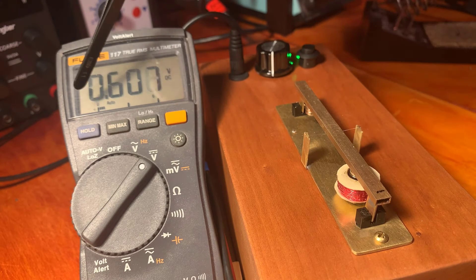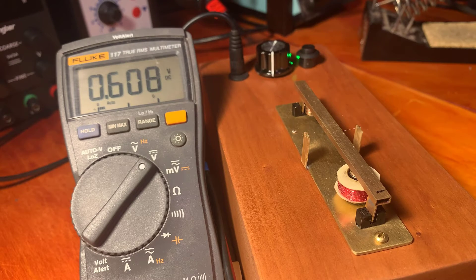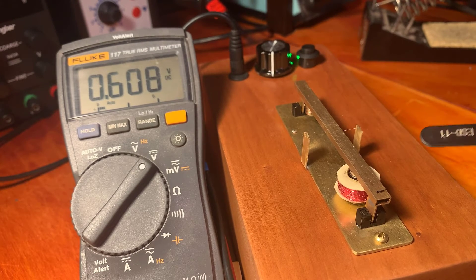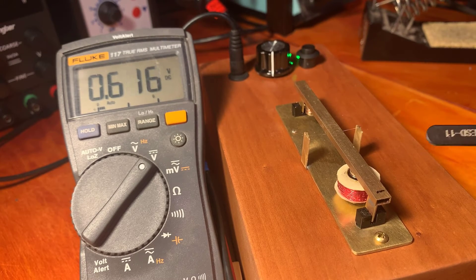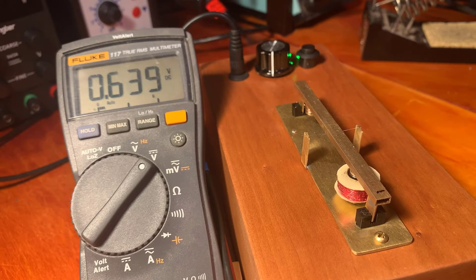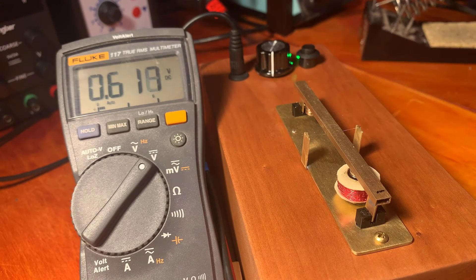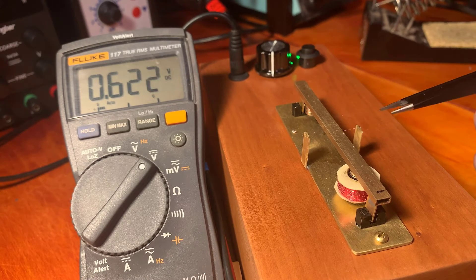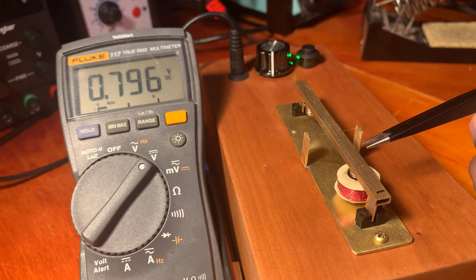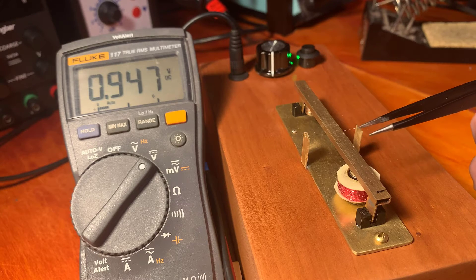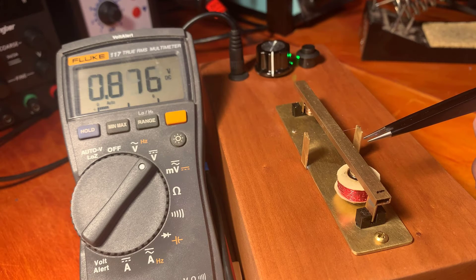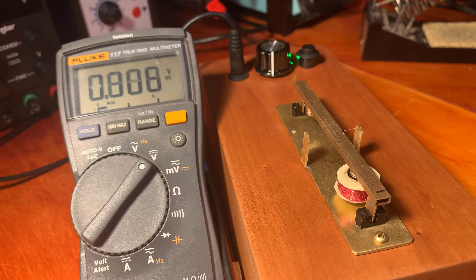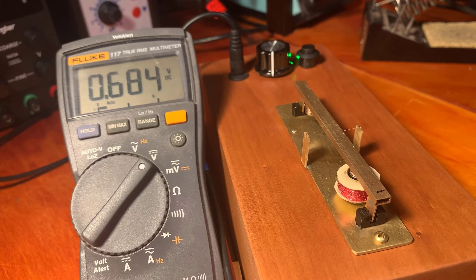As you can see right now, it's way out of balance. There's a lot of force required from the magnet. The reason this is bouncing around is that this is magnetic and there's magnets there. So as I get that closer, you're just watching the magnetic force.